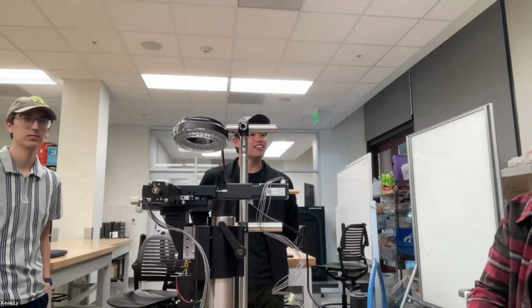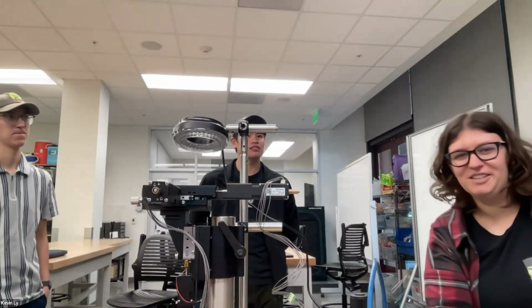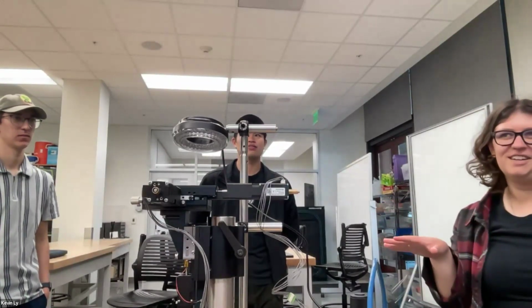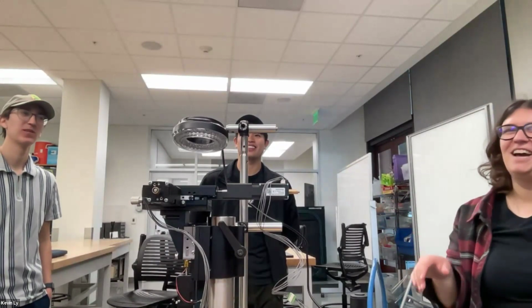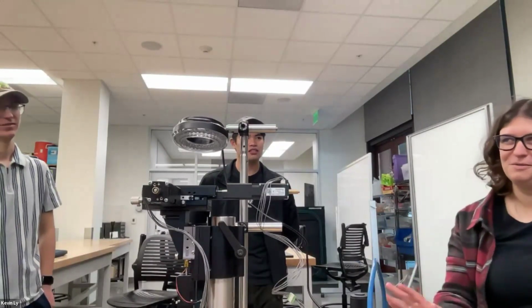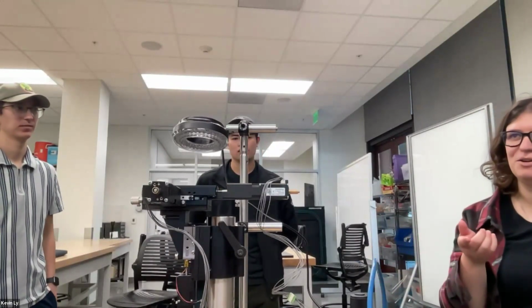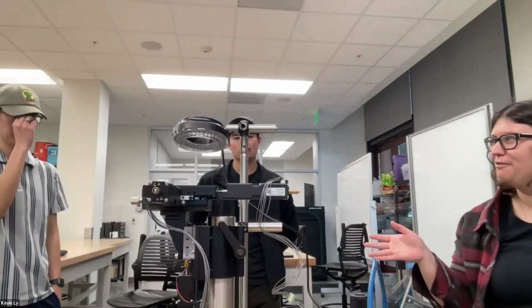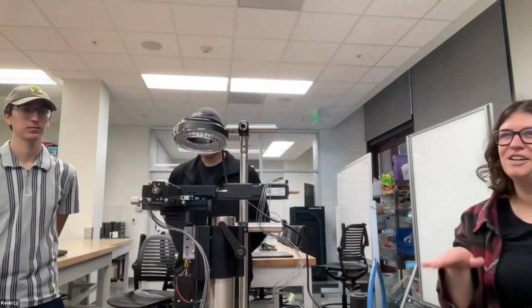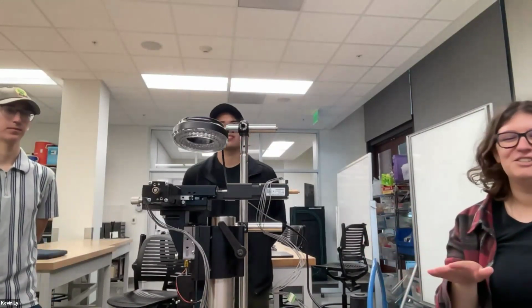Yeah, this can also just be a general Q&A. So I don't know where you guys are, y'all have projects, right? Yeah, nominally, on paper. So we can do whatever would be most useful for you during this time. I'm happy to do a demo, and if it would be helpful to have project work time, or if you would rather keep messing around with this, whatever y'all are more interested in. Demo sounds great.